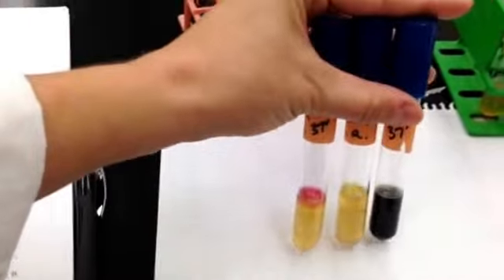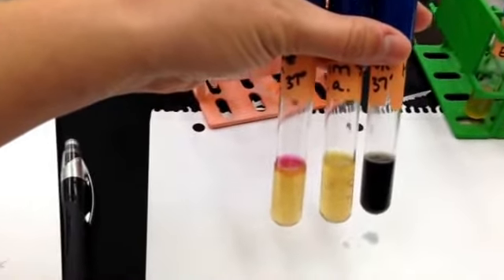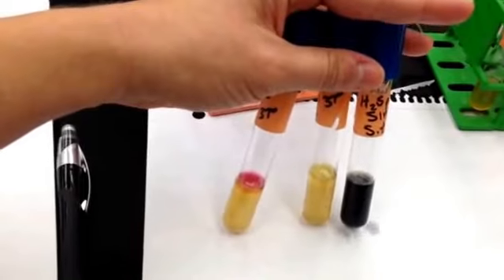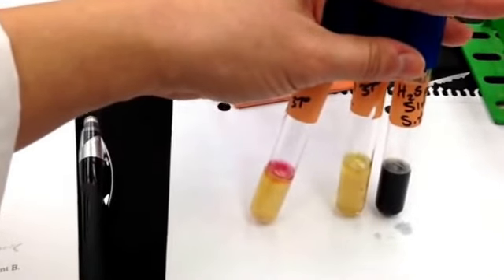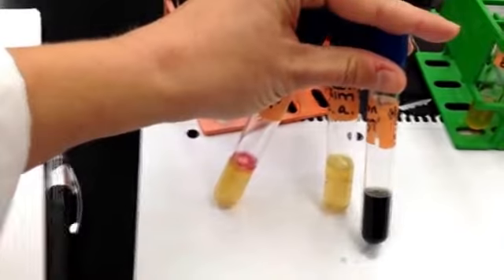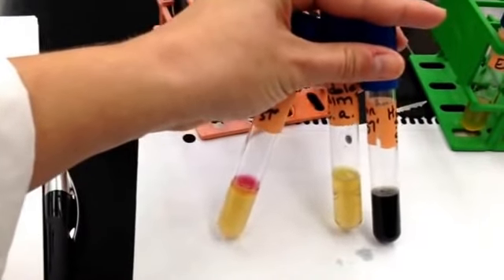Moving on to the next thing. This is 2 tests in 1 in the SIM Deeps. 3 tests in 1. So you will look right here and you will see that Salmonella typhimurium is on the right. Salmonella typhimurium produced sulfur, which is the black precipitate. And it is motile. You can see that it's motile because it all turned nice and black.